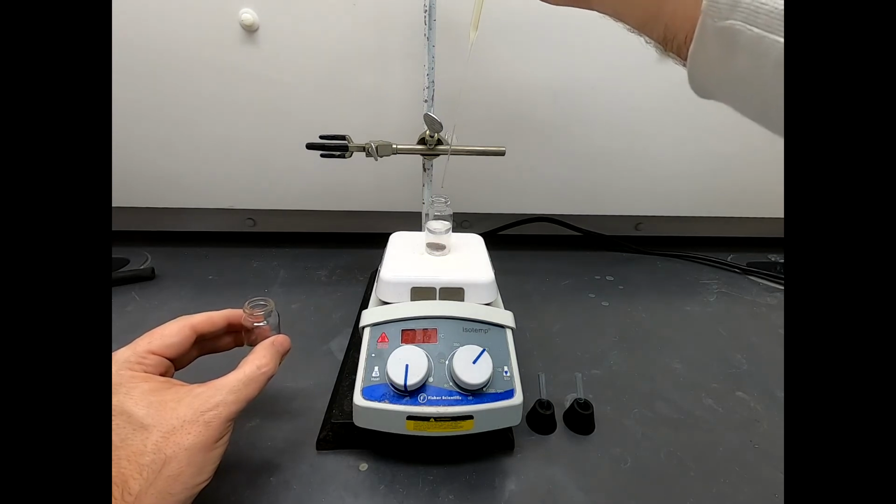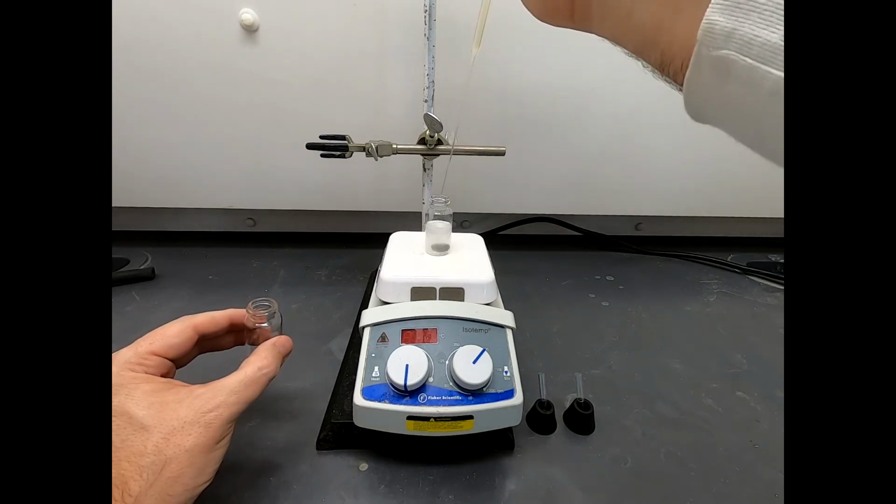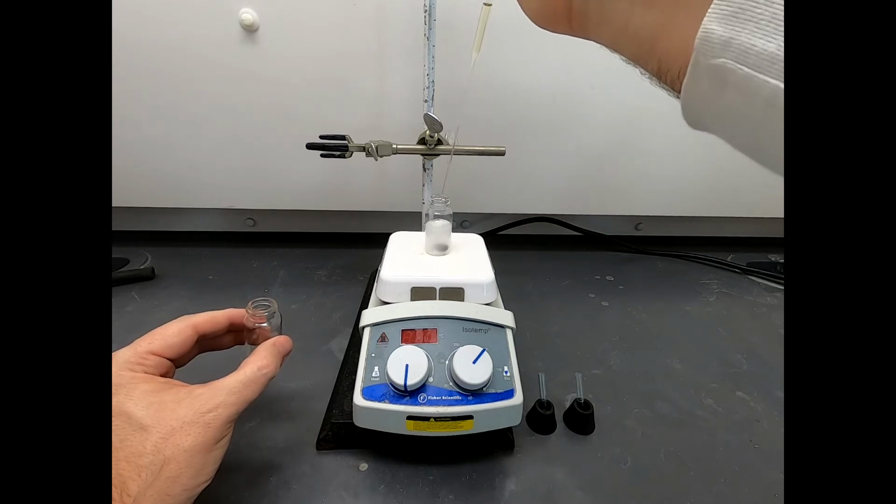And you'll see that this is getting cloudy. When you form solids, unless they're super fine solids, they don't look cloudy. It looks like you have solid floating in a clear solution. This does not look like a clear solution. This looks like a cloudy, almost like milk. Much more of an emulsion. But that's okay. I think I can fix that. Okay, so we're still adding with good vigorous stirring.